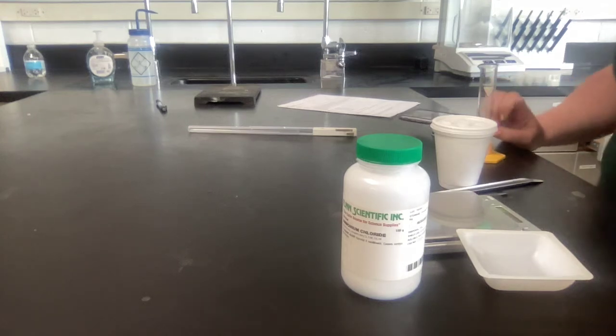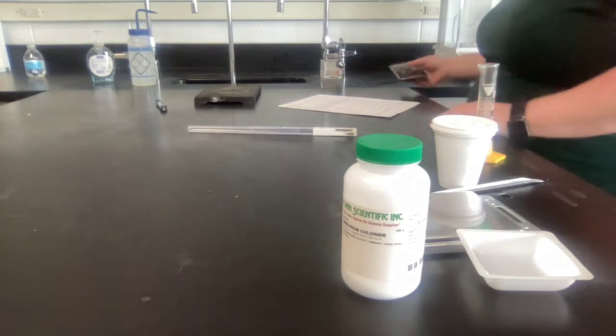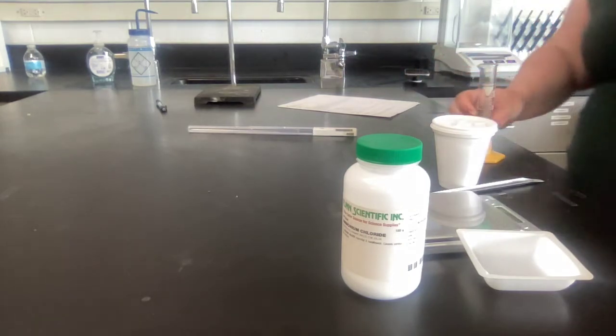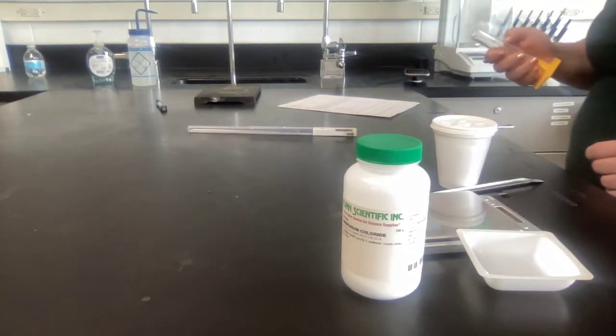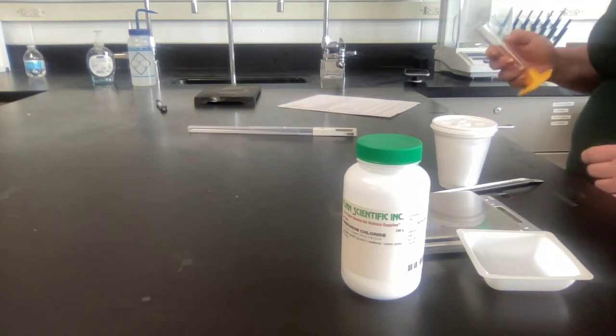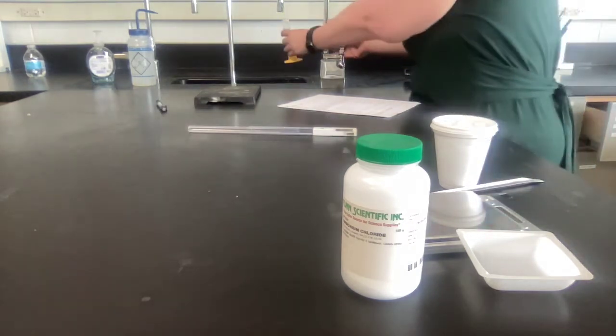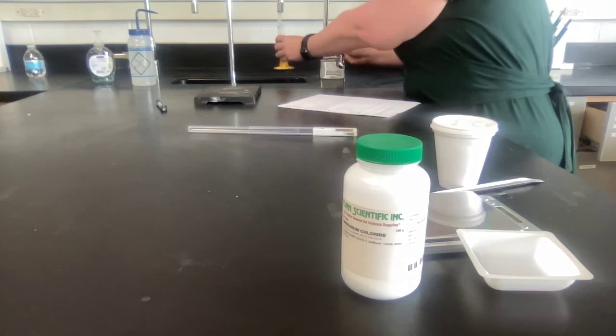For this lab, it's pretty straightforward. You are going to measure out between 25 and 30 milliliters of water, and you can just use the sink water, tap water.